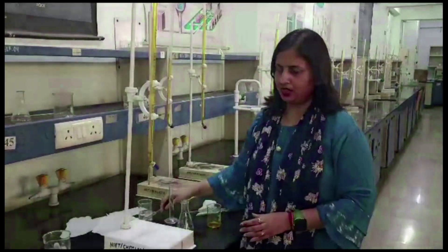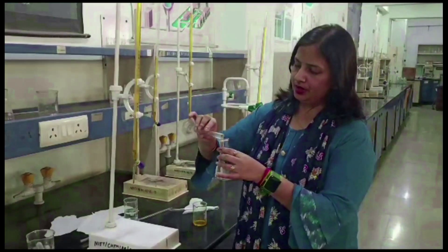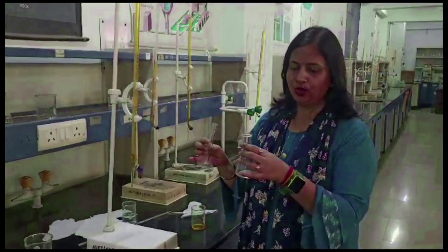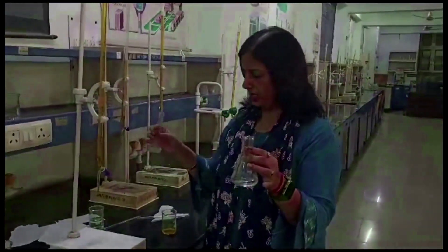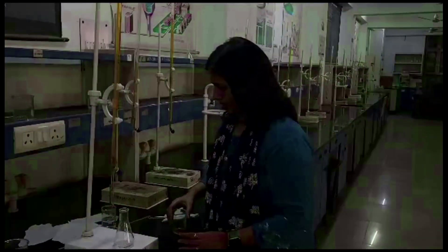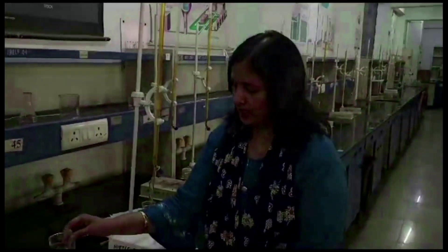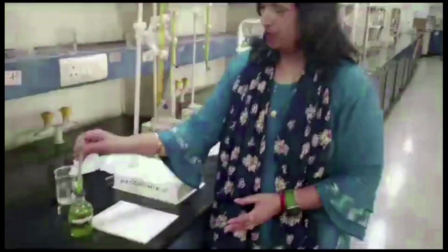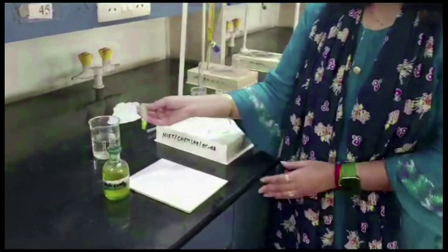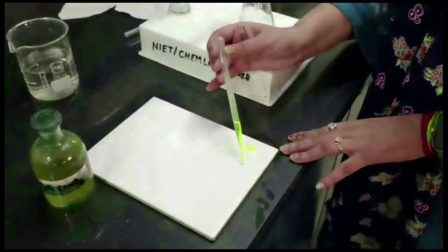Firstly, pipette out 10 mL of Mohr salt solution and transfer it into the conical flask. This is the external indicator — potassium ferricyanide — and we use it on a white tile. So we put some drops of this indicator on the white tile.